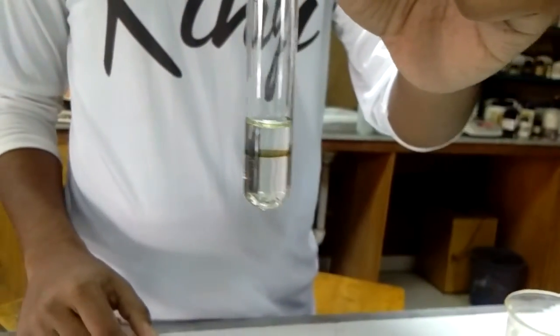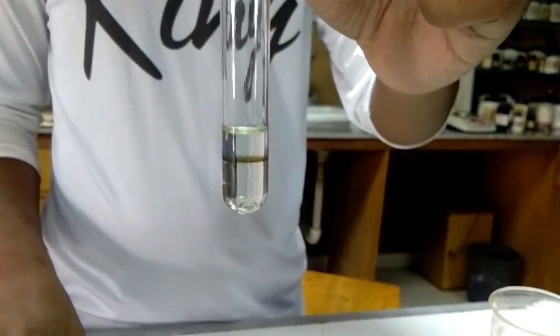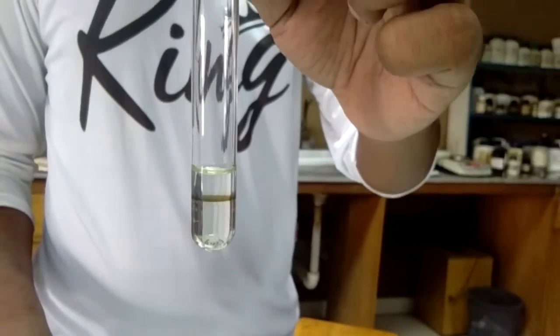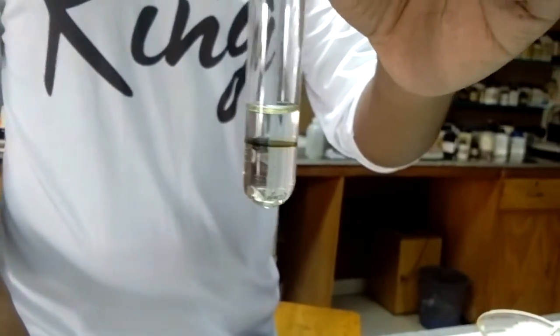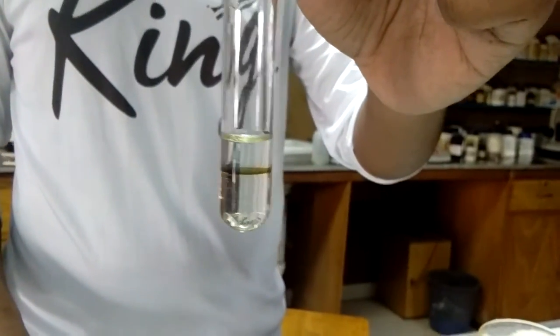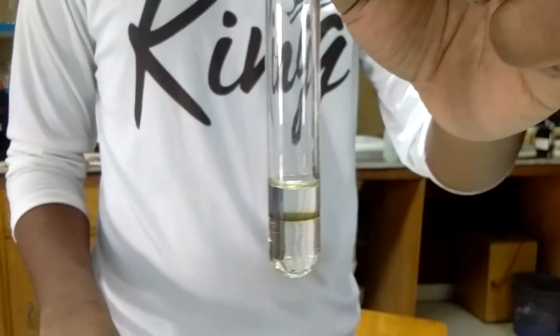This is the so-called famous nitrate ring test for nitrate ion. The ring may or may not appear at the first attempt. Then you have to put this test tube in the ice bath.